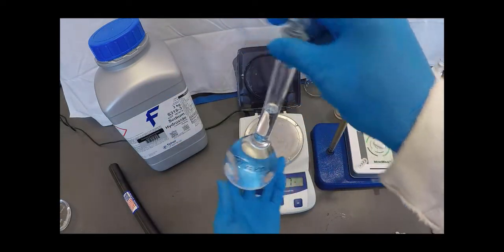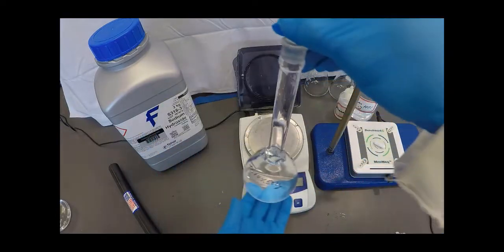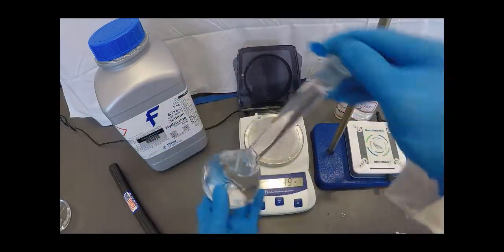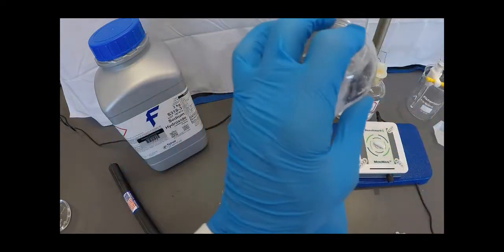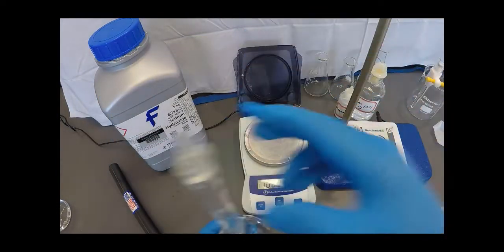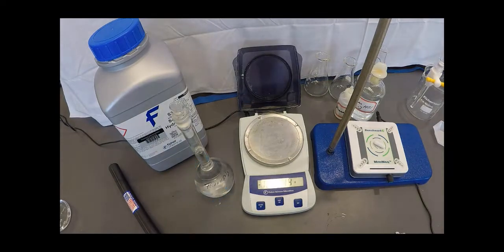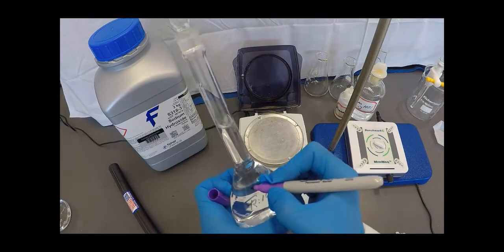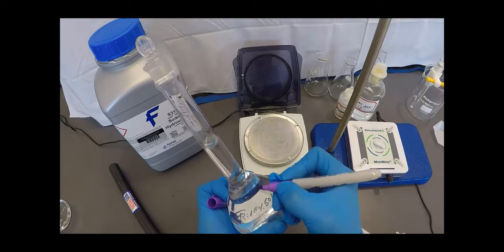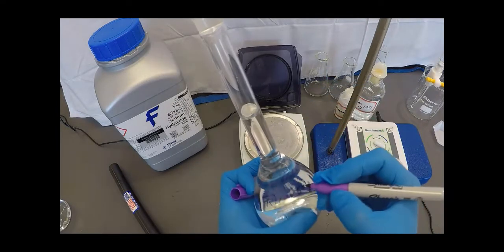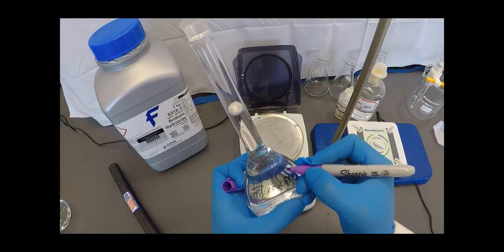So I've got my volume. I'm going to give it a few tips upside down, make sure it's well mixed. And there I have it. I've got an approximately 0.1 molar sodium hydroxide solution.